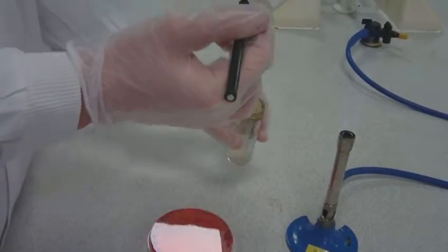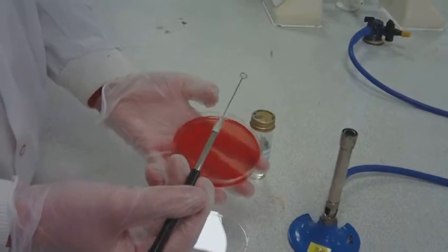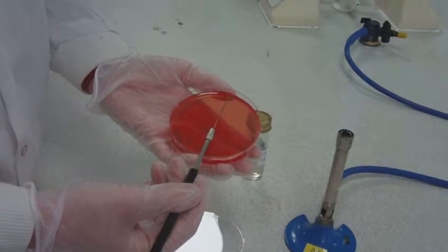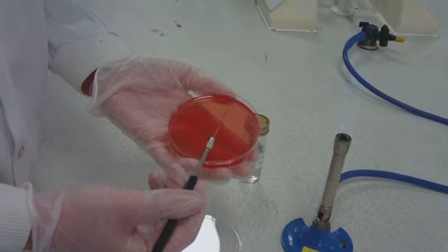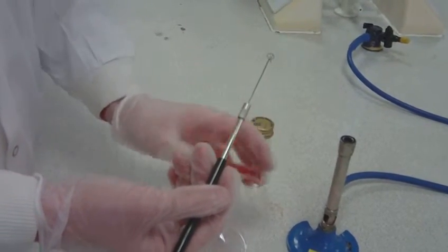Partially lift the petri dish containing the solid medium. Then with the loop containing the bacteria, rub a small circle immediately onto the agar at your first dot, 12 o'clock, to prevent liquid from running down the agar.